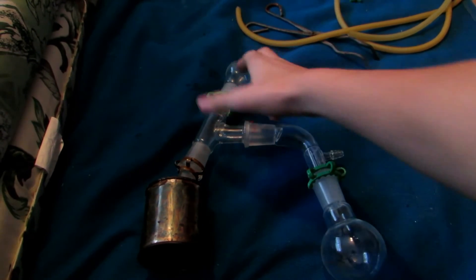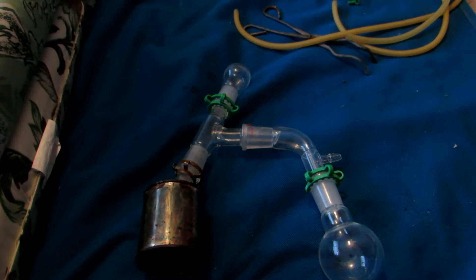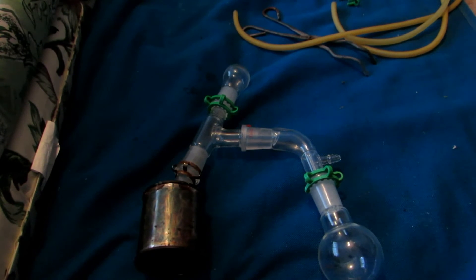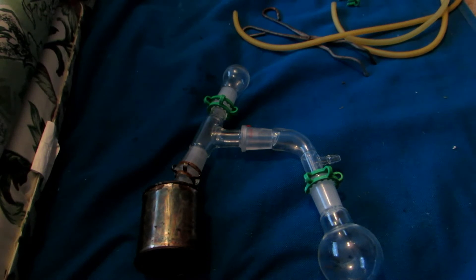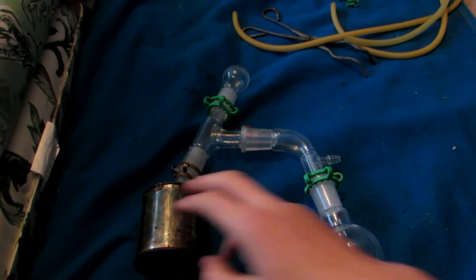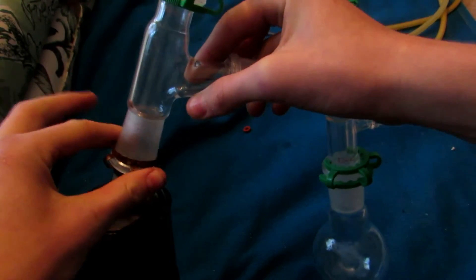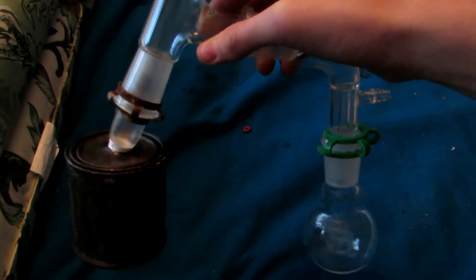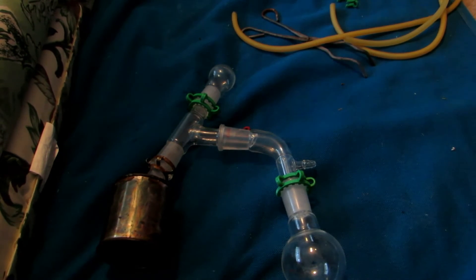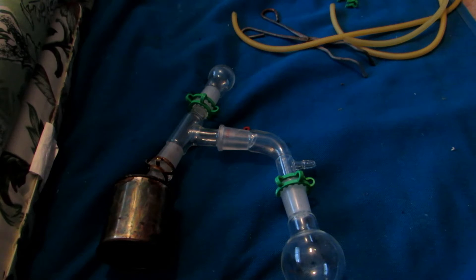The apparatus has now all been set up. We just used a small 25 milliliter round bottom flask as a stopper at the top. You don't need to install a thermometer here because we're not actually selectively distilling anything — we're just bringing everything over because we're decomposing it. There's 30 grams of salicylic acid in our container. We'll bring this outside to our burner and start heating this up to very high temperatures, hopefully enough to decompose everything and start distilling over some phenol.